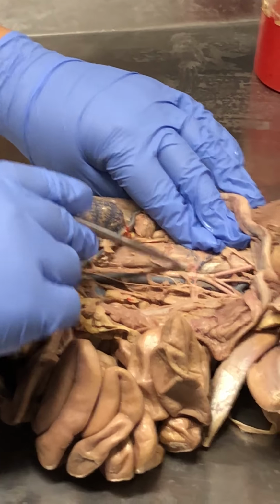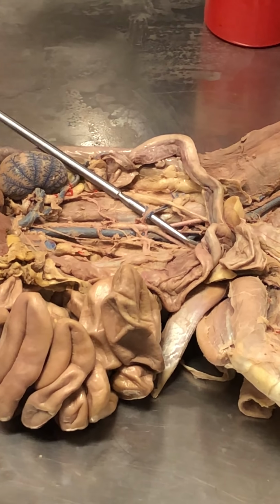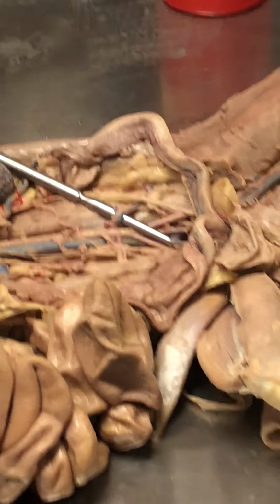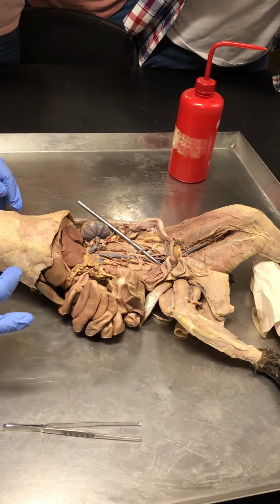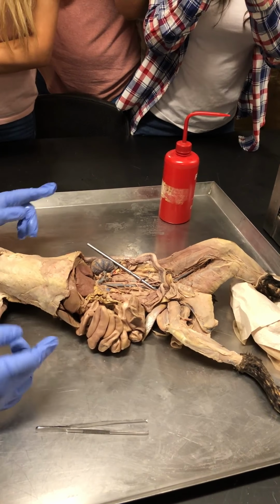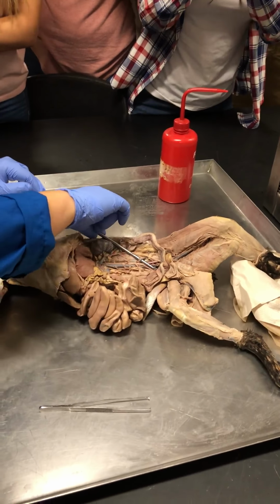When you do, take a look at this paired vessel, artery and vein right there. That is the left lumbar artery and vein. You got 5 of those because you got 5 lumbar arteries. Okay, this one's part of number 4, right? And so those vessels go, well, to the body wall. Okay, so at least take a look at that.